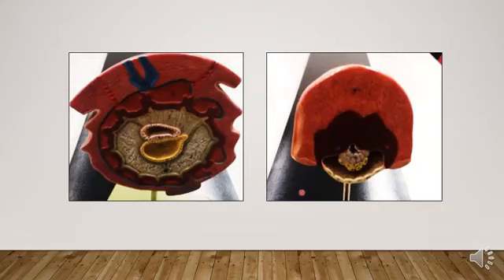And these sections show two slides. This is the early bilaminar germ disk, which consists of the epiblast, hypoblast, and amniotic cavity. Amnioblast cells of the amniotic cavity. The cavity is the blastocele, and trophoblast differentiated in two layers. Cytotrophoblast, thin mononucleated layers, and multinucleated syncytium, and the uterine mucosa.